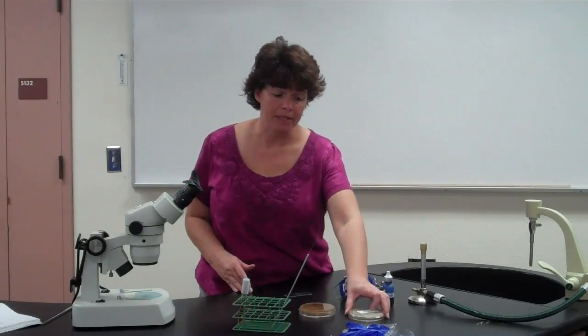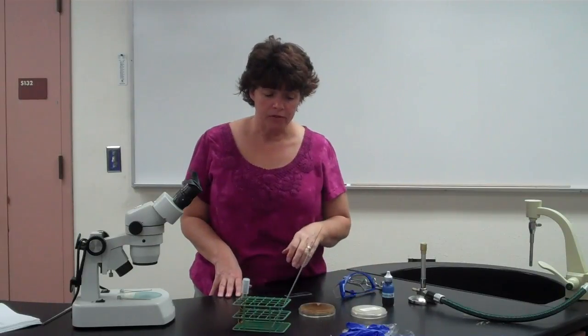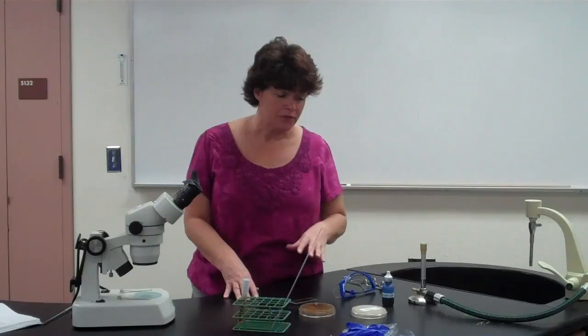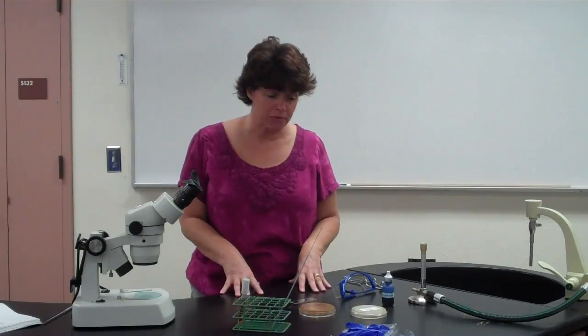So with the yeast, we looked at their sexual reproduction, asexual reproduction, budding, things like that. And we also looked at fermentation. So fermentation of yeast was a way of also identifying them. That's not what we're doing with the mold. With the mold, you're going to identify based on the characteristics of how they look on a plate, and also how they look on a slide, what kind of spores they have, sexual and asexual. So this is kind of a 3-part lab, just like the last one was.